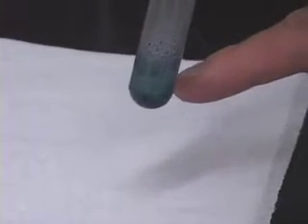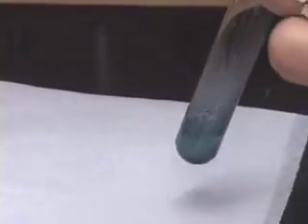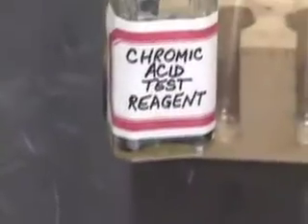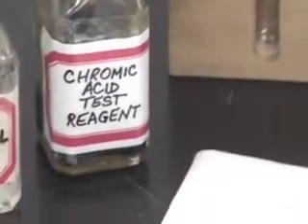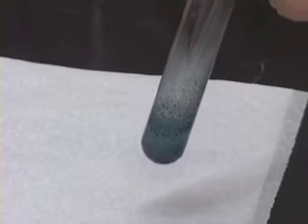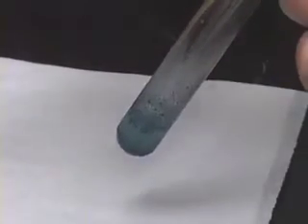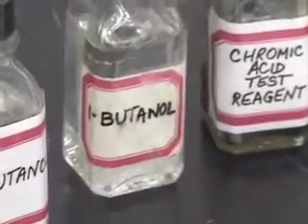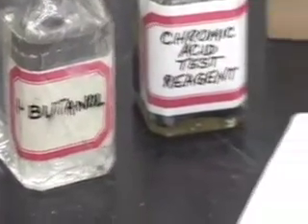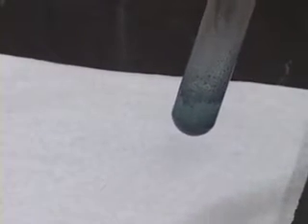The appearance of the blue-green opaque precipitate within a few seconds after adding the chromic acid test reagent indicates a positive test result. In other words, it says that the compound tested is either a primary alcohol or a secondary alcohol. Since I used 1-butanol, which happens to be a primary alcohol, it should give a positive test result — and indeed we did get a positive test result.